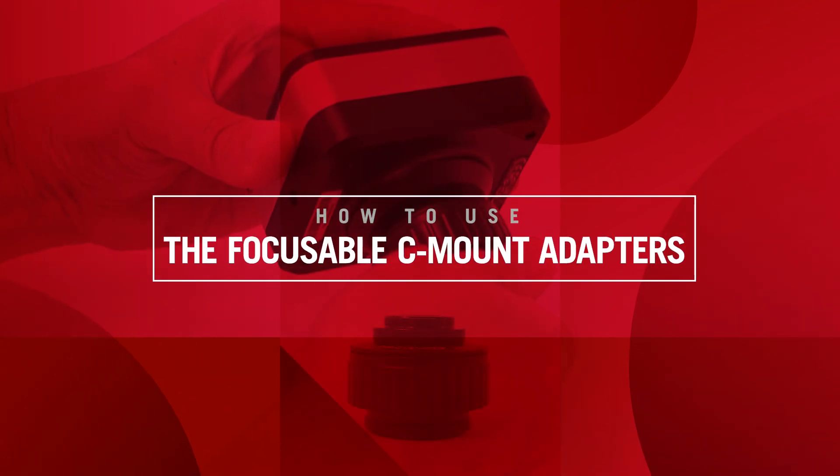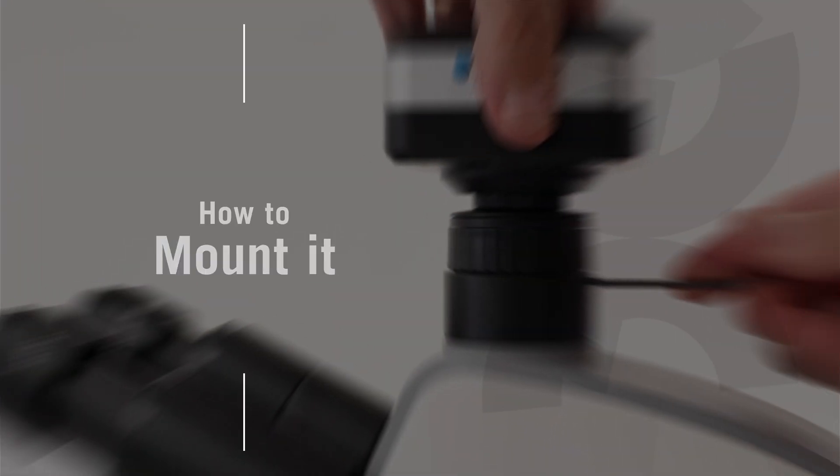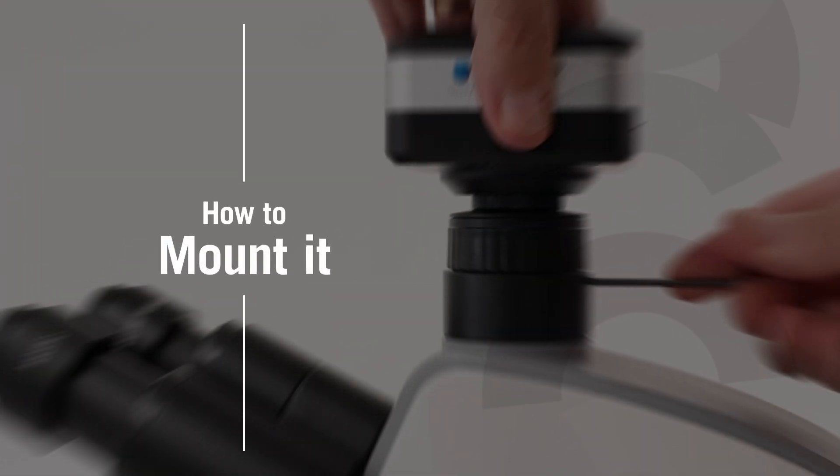In this video we will show you how to mount and use the focusable C-mount adapters. Let's begin by mounting the focusable C-mount adapter on your microscope.